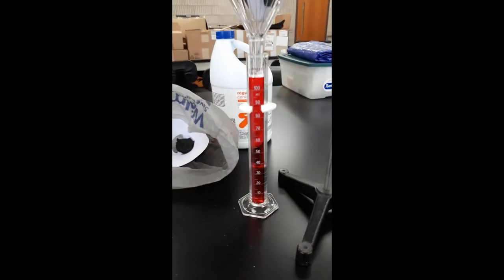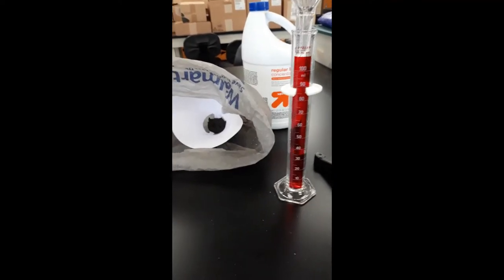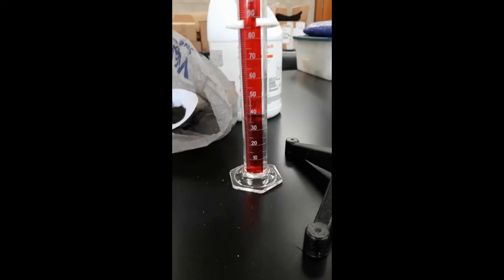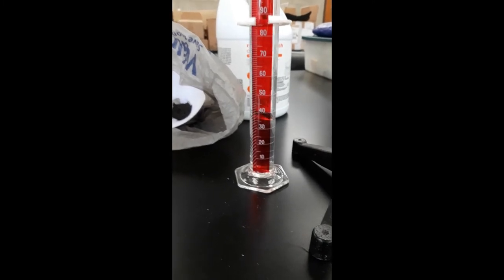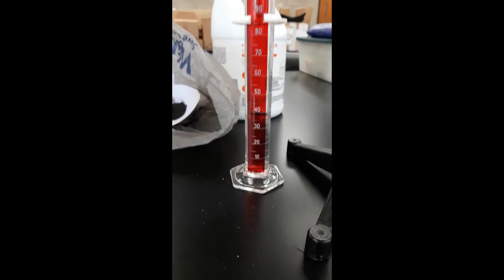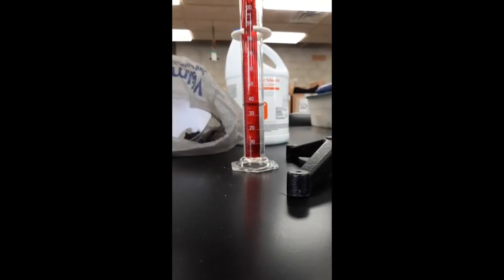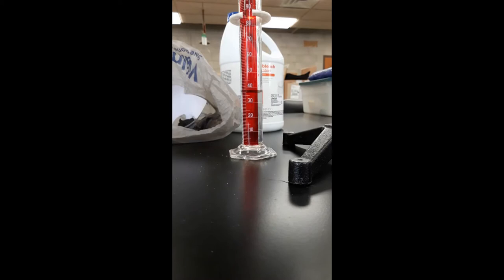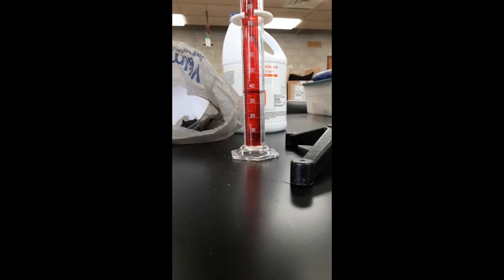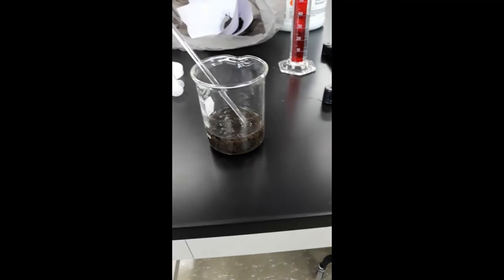Okay, so now we've got the one that had a half a mil, and we've got approximately three minutes left to go on that. So we're going to start the next one, we're going to add two mils. Here is the reading with the 0.5 mils after five minutes.